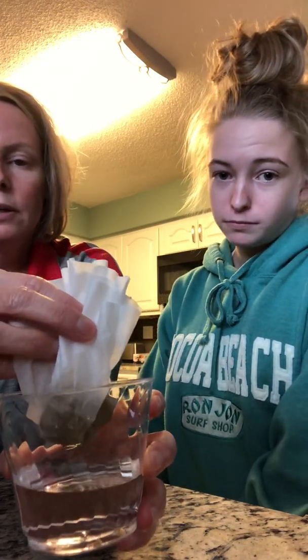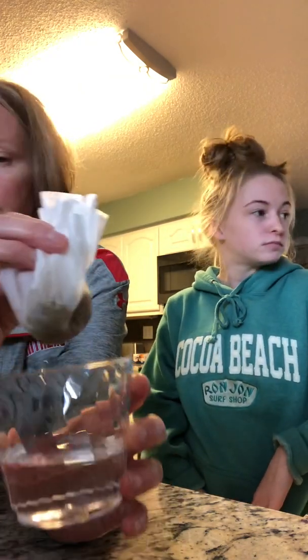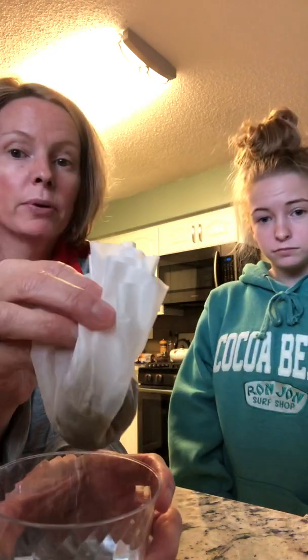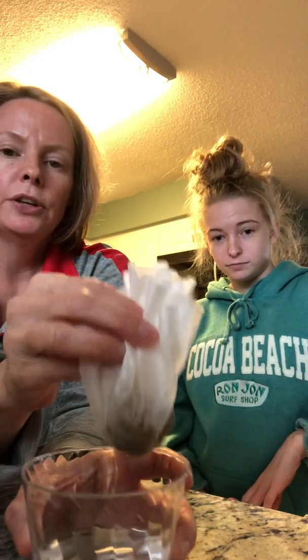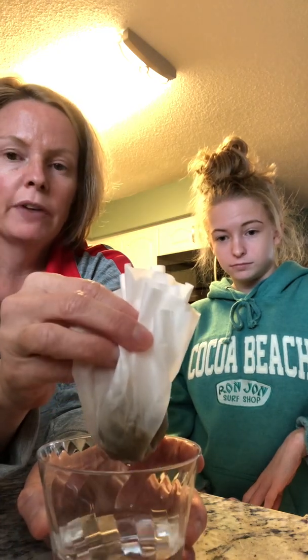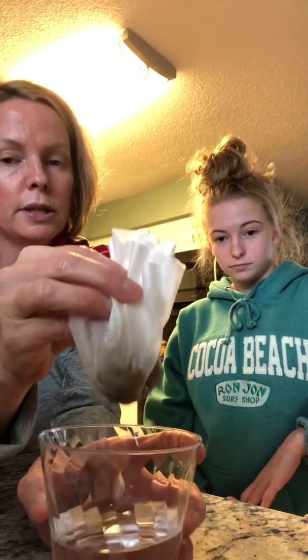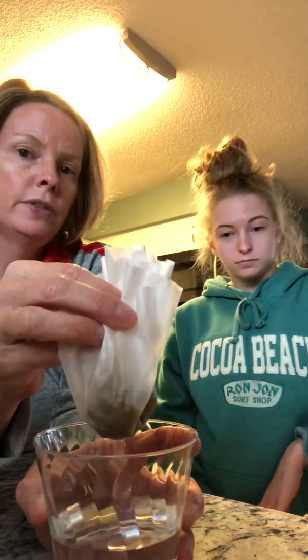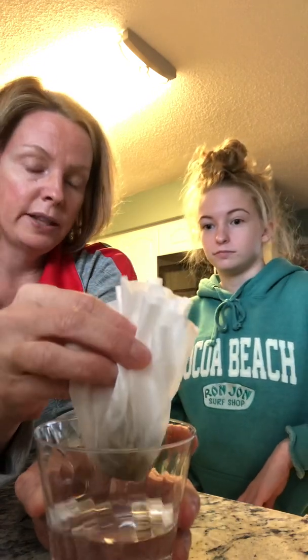So you will then answer on the lab sheet what was in the coffee filter, and then what was left in the cup. And then based on what we were able to do, which is separate the sand and the water, is that a mixture or a solution? Then you're going to go back into the textbook and you're going to find proof for your answer. If you decided this was a mixture, then you have to find proof in your textbook to say why this was a mixture. And if you think this was a solution, you have to find proof in your textbook as to why this is a solution.